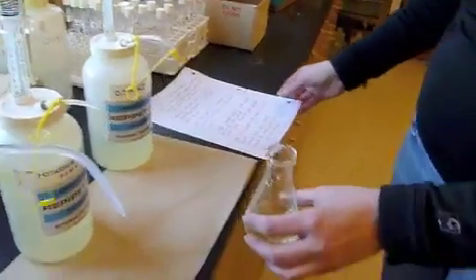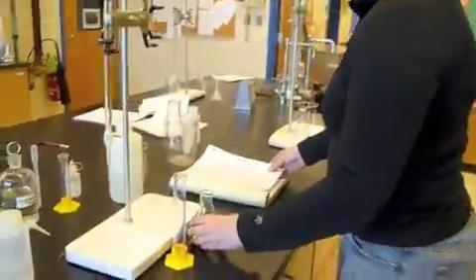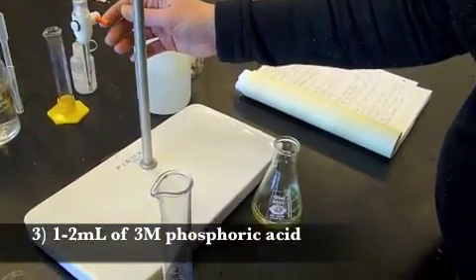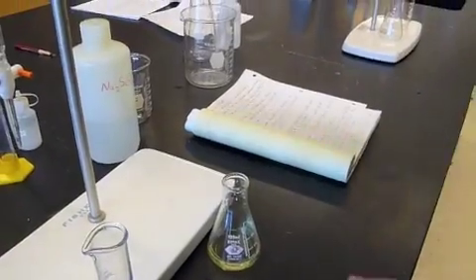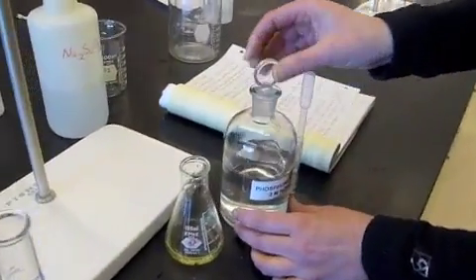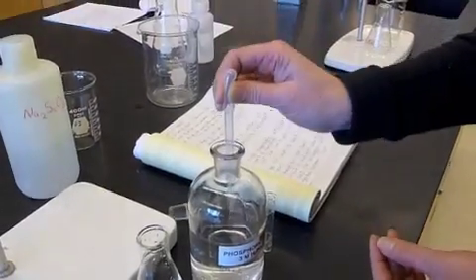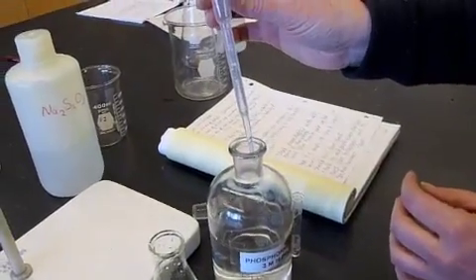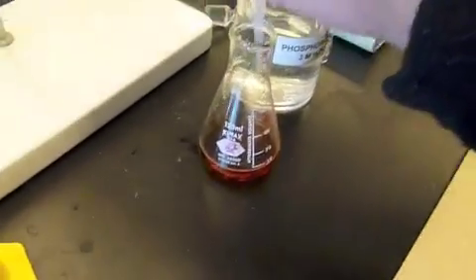There you go. All right. And it's already starting to turn yellow. Then I'm going to take one or two milliliters, I usually take about two, of the acid. We have phosphoric acid. And this is just a disposable pipette. I'm going to try to get it to two. I'm going to put it in immediately, and it starts turning that great color.